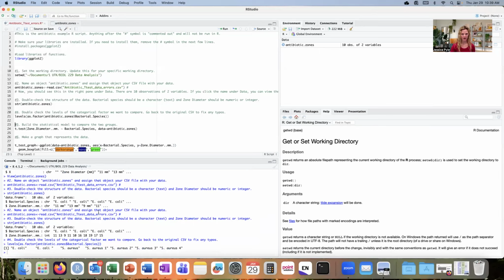Okay, I see a problem right away. I know that I should have 2 levels because I have 2 bacteria that I measured, but it looks like I have more than 2 levels in this data frame. I have 2 different examples of E. coli, and then there's 5 different levels for Staphylococcus aureus. And I can see right away that each of these Staphylococcus aureus levels have a number at the end. So when this person entered data into the CSV file, they must have entered a unique number for each Staphylococcus aureus species that they measured. We will have to go back into the Excel file and delete those numbers.